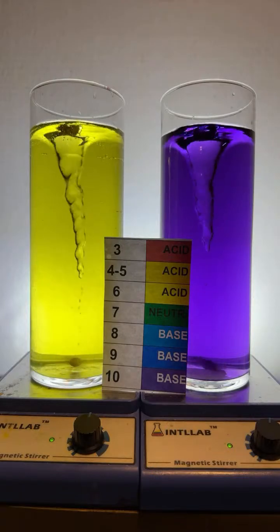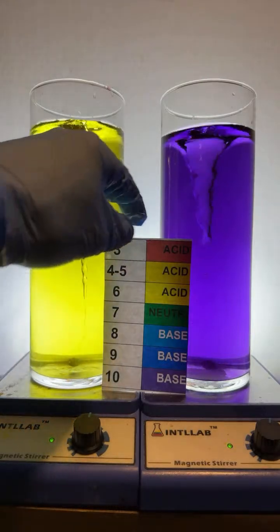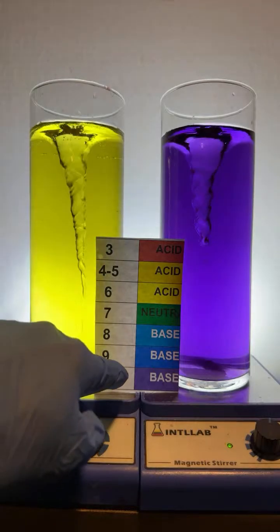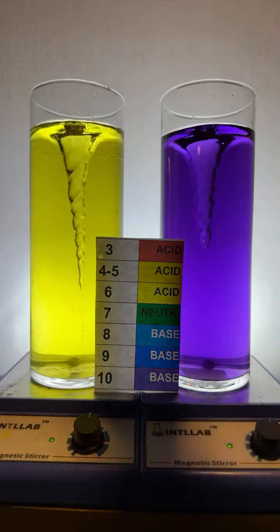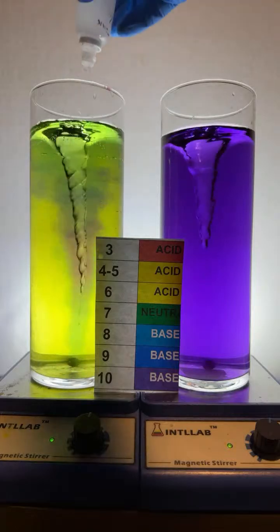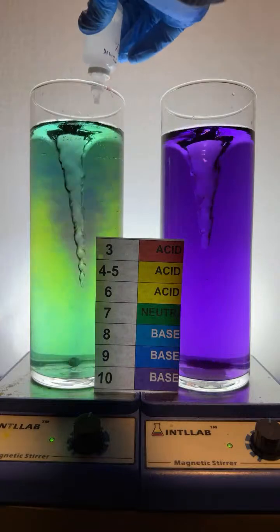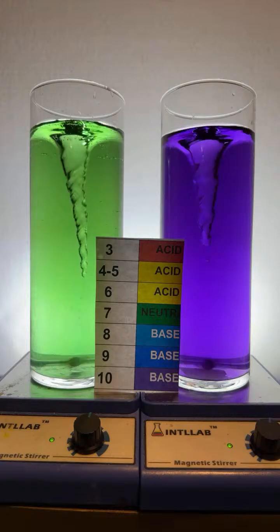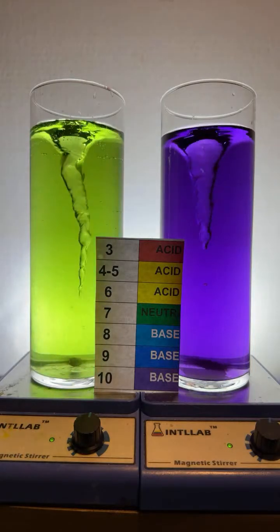Yes, Ethan, there are levels below pH 3. Unfortunately, my indicator system will only show red at pH 3 and below. It will also only show violet at pH 10 and above. Eden, the yellow one won't change because it is buffered. I've got both an acid and a base present in here that resist changes in pH. I'm adding a bunch of base right now to the buffered system. And maybe I've added enough base to get it off of pH 6, but I'm not sure. Great question.